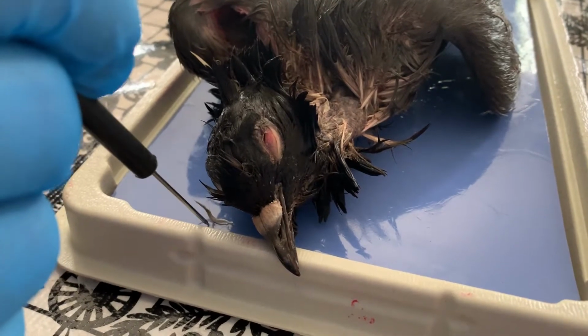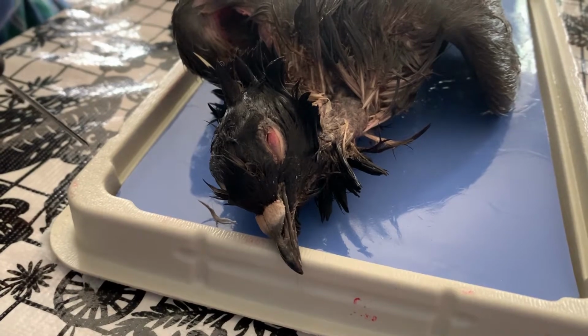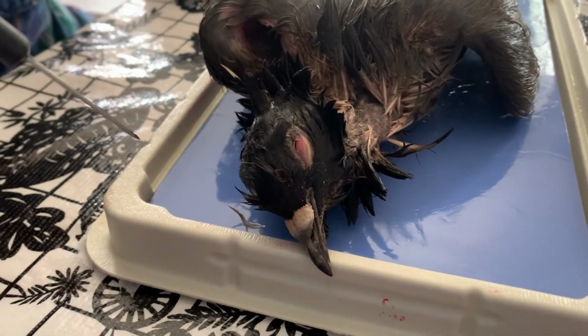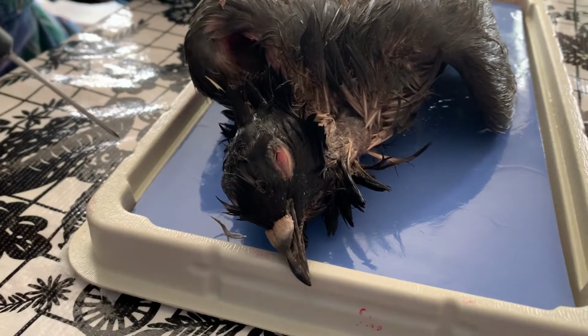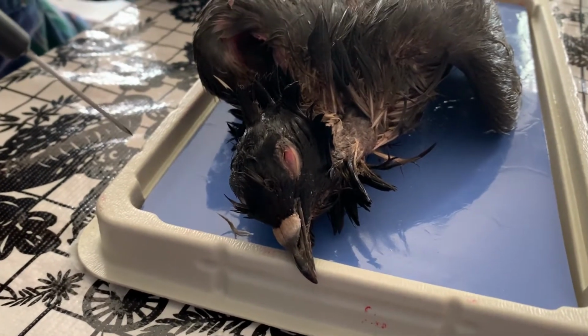For birds, and for us as well, the nictitating membrane is what we see as kind of like our tear duct, down in the corner of your eye. On dogs, it's a little more pronounced than it is on humans, but it comes out of this amphibian and reptilian heritage that we all have.